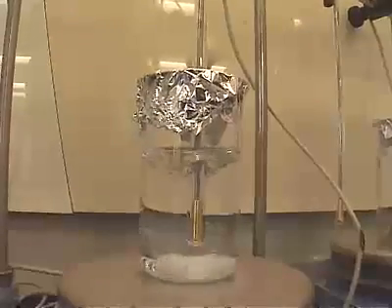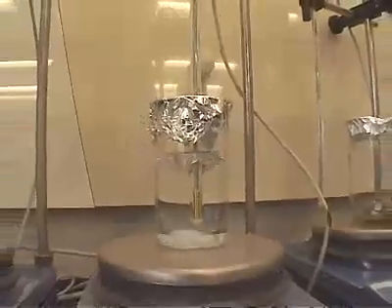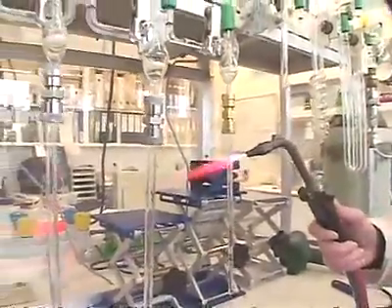In radiocarbon dating, it's very important to remove any contaminating carbon. So the second step in the procedure is to give the sample a series of chemical washes to remove any material that might have been added to the original carbon after it's been in a burial environment for some time. Then we go to the third step in the procedure. After the chemical washes, the sample is dried, and the third step in the procedure is combustion.